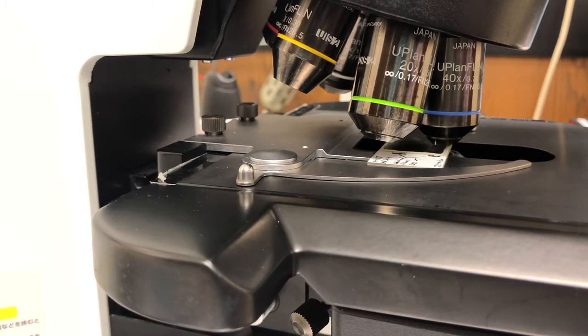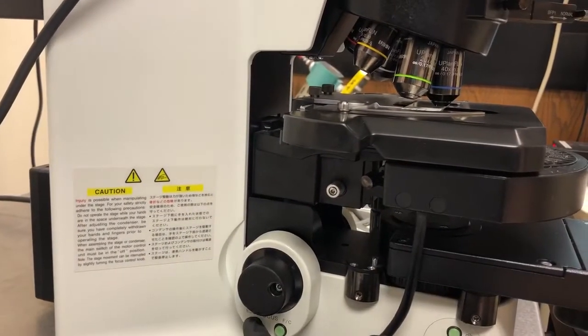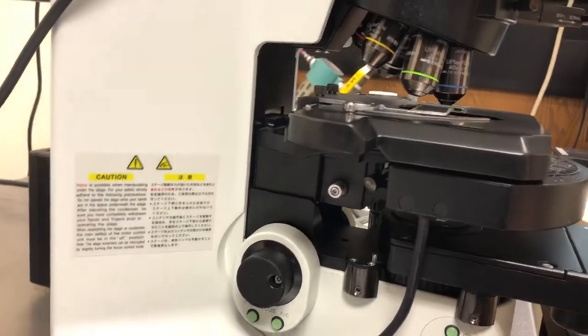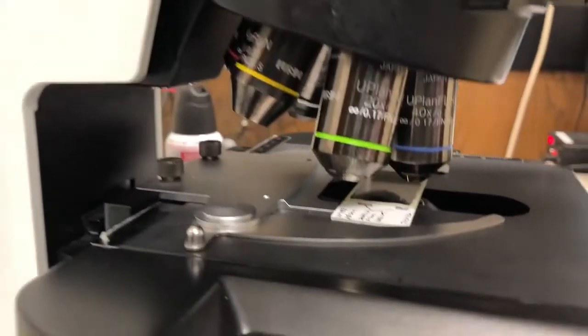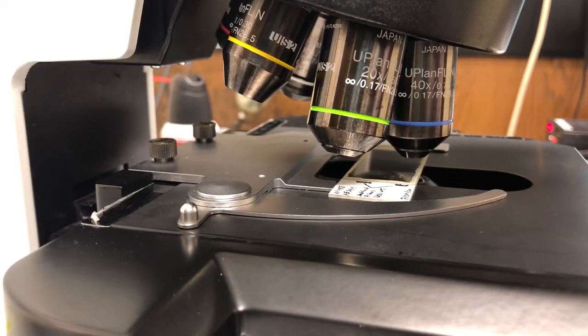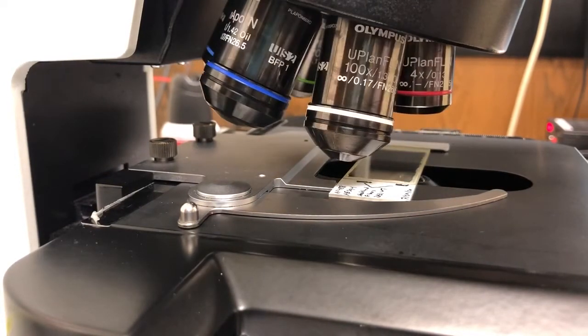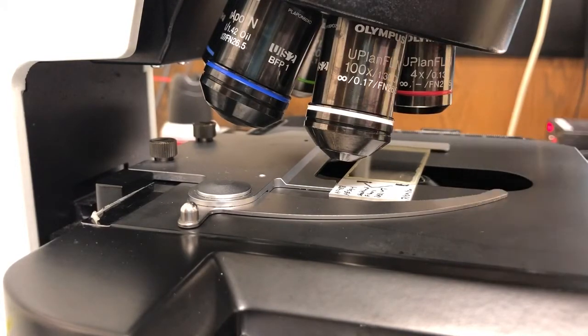To do that it's a good idea to leave some room there in which to apply the oil and you can see that there's not actually a lot of room there to do that. So I frequently just switch to the 4x position, not because I'm going to use the 4x but just because it gives me more clearance to apply the oil. So that's what I'm going to do now.